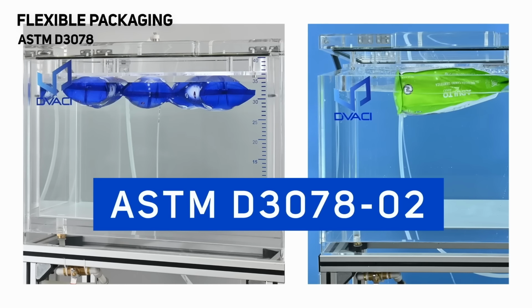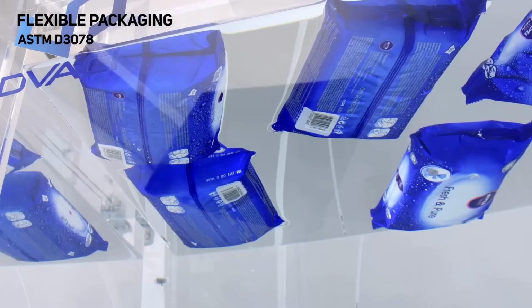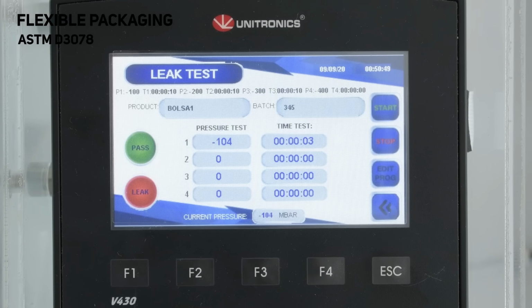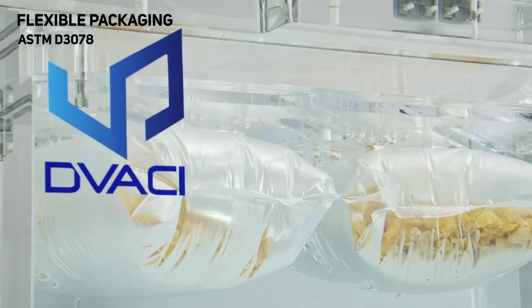This is a visual detection test that precisely identifies the location of defects in the seal or packaging surface by submerging the package and creating negative pressure inside the chamber. This causes the packaging to inflate and the internal air to escape, forming bubbles if leaks are present.